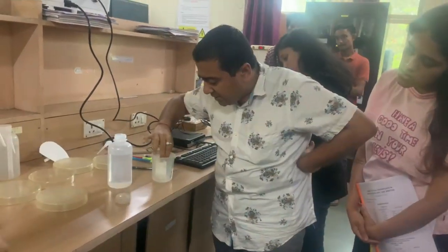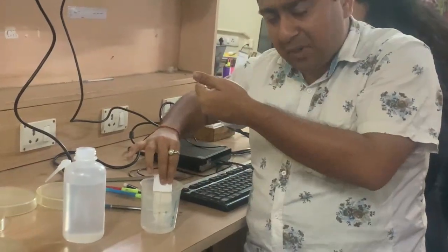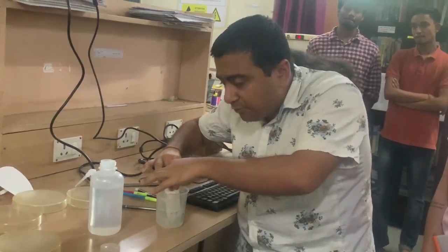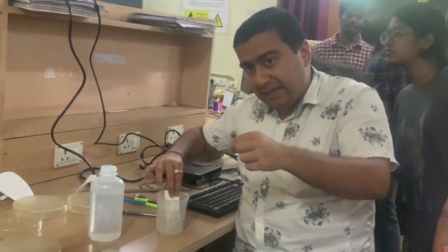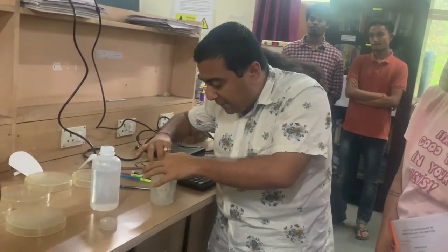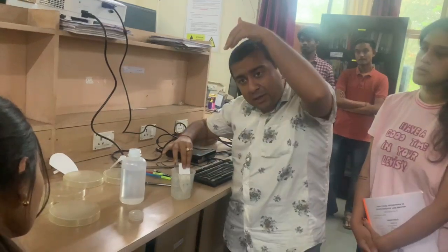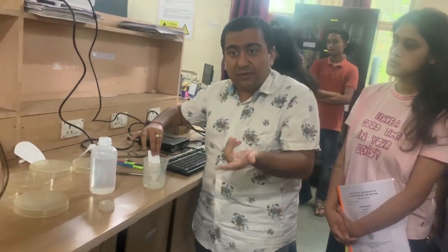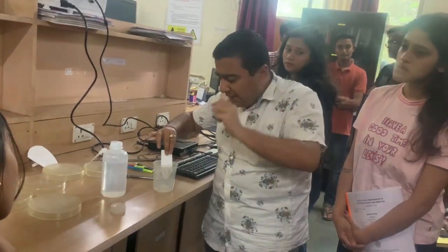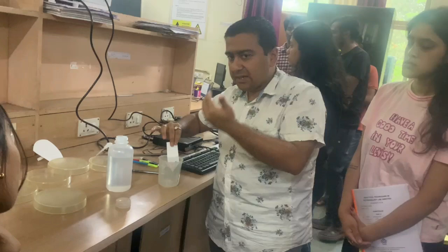Dip it. Even if you see, it has to be straight. Normally it should go up. It's moving down because you have to be very careful about it. I'm just showing you. You have to do it in such a way that the movement goes upwards. That means you should not dip it completely. I'm showing you why, because most people will do it wrong. You have to dip only the tip part. See, it has already moved. It should move upwards. Why did it move downwards? Because if you dip it too much, then it may move downwards. So you have to be very careful while dipping it. That means you have to decrease the amount more. Take a very little amount of water, only to dip the tip, and then the water will move up. Clear? Clear what I'm saying?